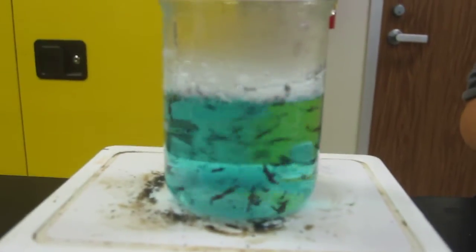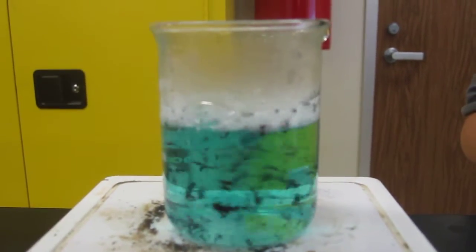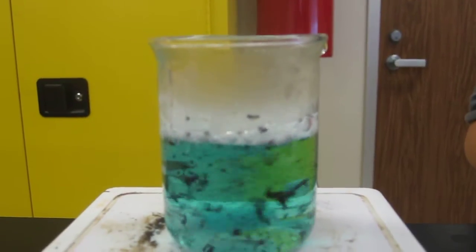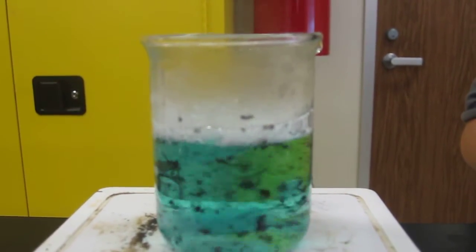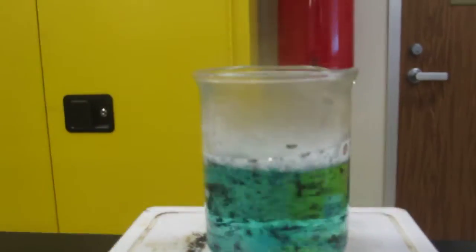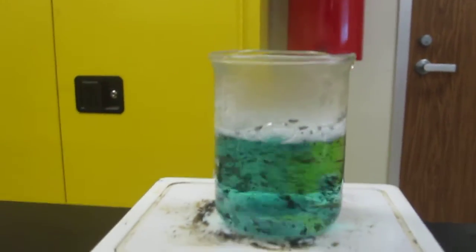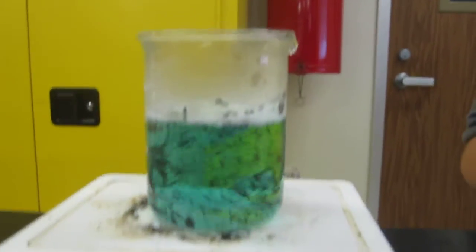So hopefully you guys can see the copper precipitating out there. The reaction is very exothermic, right? You can see the bubbles, it's hot coming off there and of course a little bit of acidity.